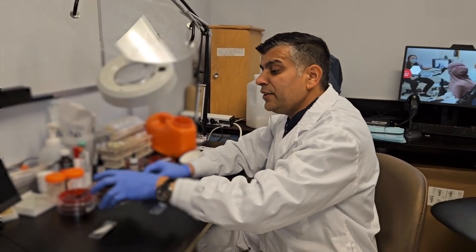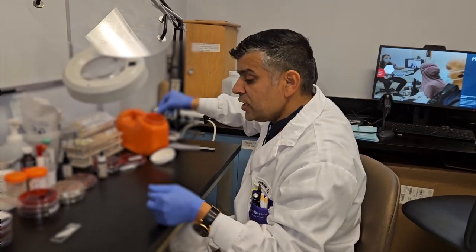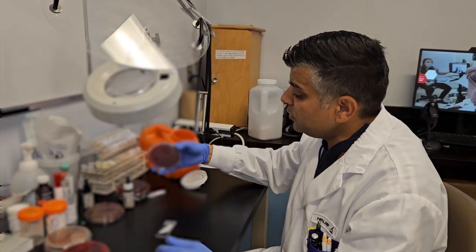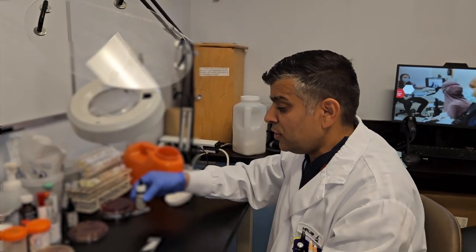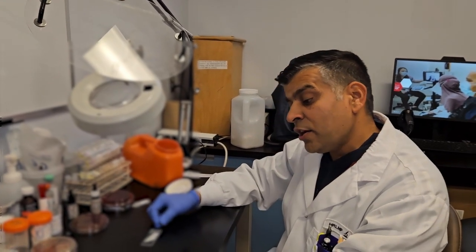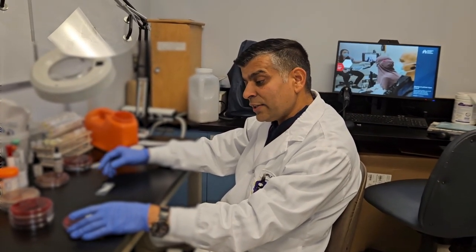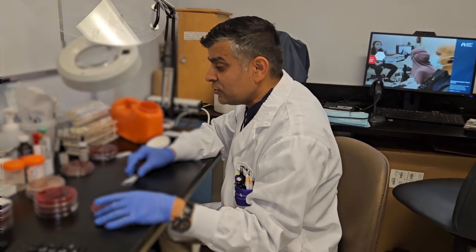The next biochemical test is the oxidase test, which I'm going to do now. The oxidase test is basically done to differentiate groups of bacteria, most commonly Pseudomonas aeruginosa from other enteric bacteria which belong to the same family. However, oxidase positive reaction is shown by other bacteria as well, for example Aeromonas, Vibrio, Plesiomonas, and Neisseria. All of them produce the oxidase enzyme like Pseudomonas.